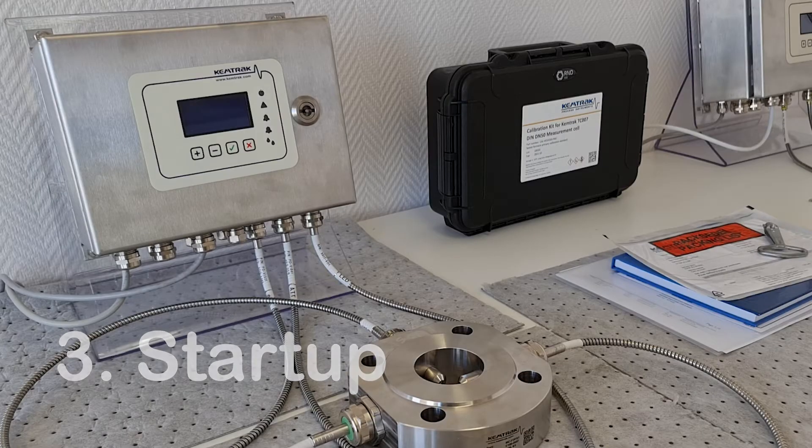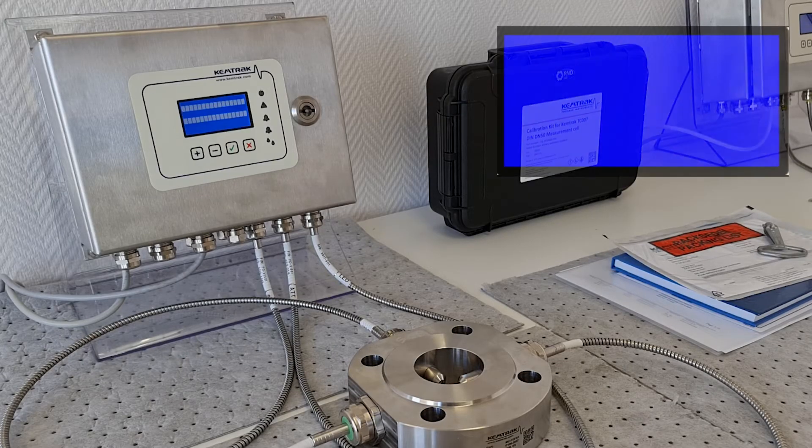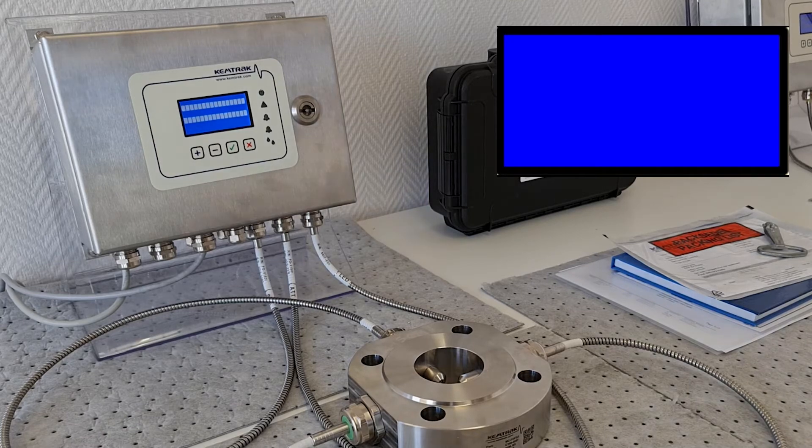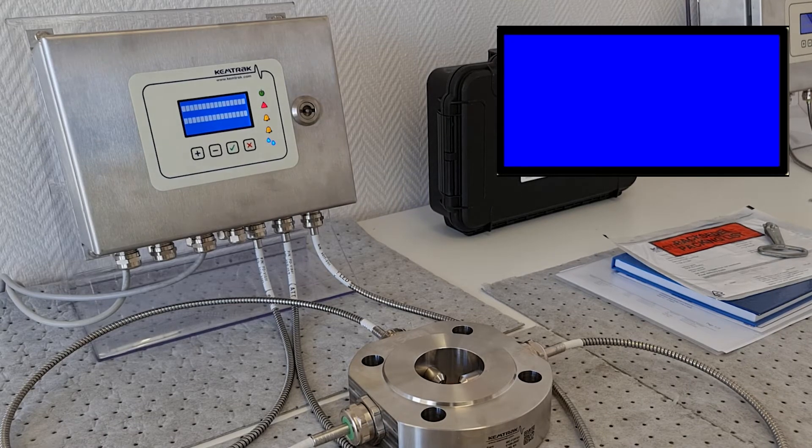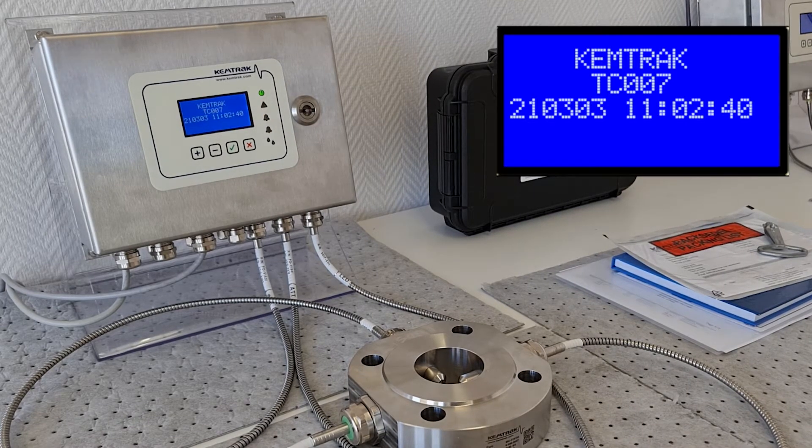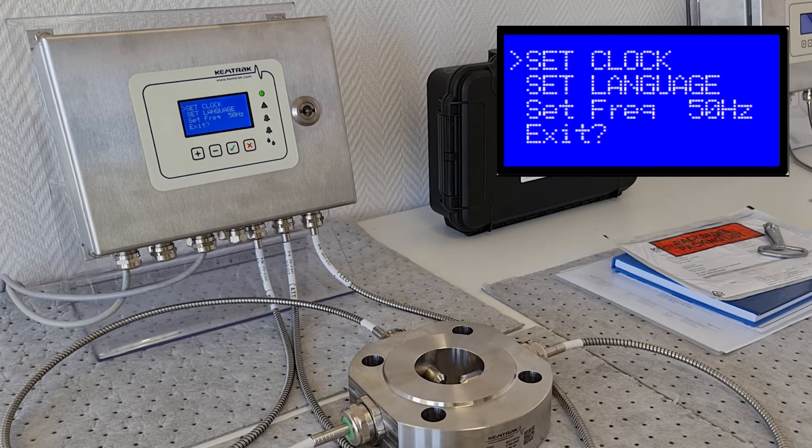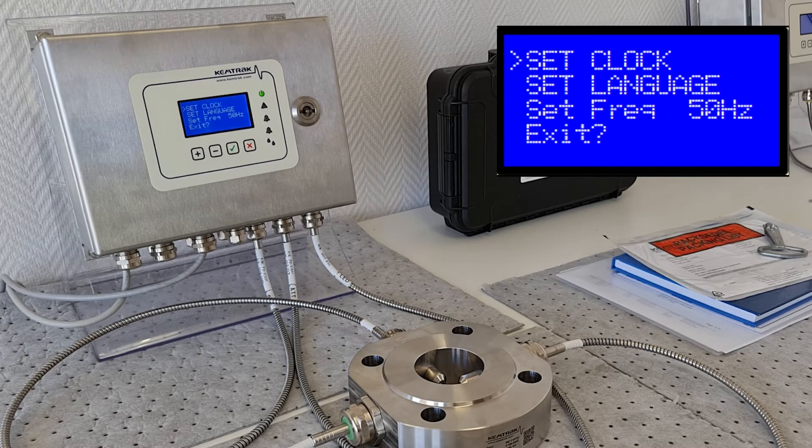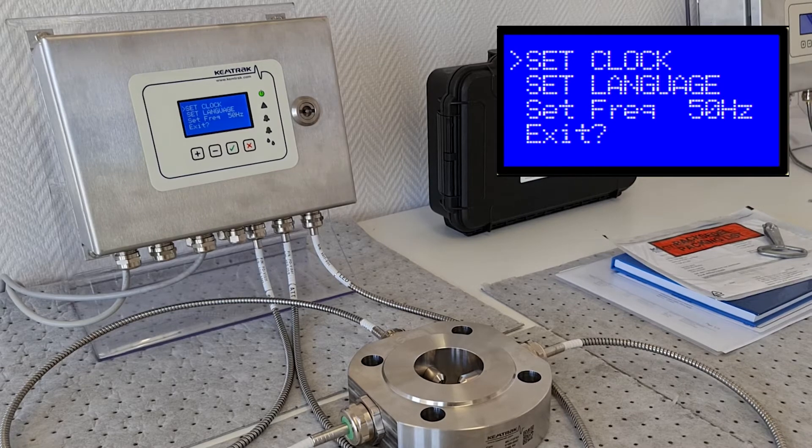The installation of the analyzer is almost complete. It is now time to turn on the power to the analyzer. The instrument's startup screen will ask for a few parameters that need configuring before use.